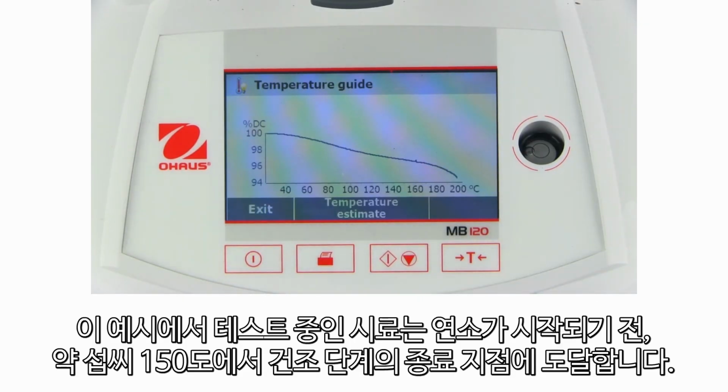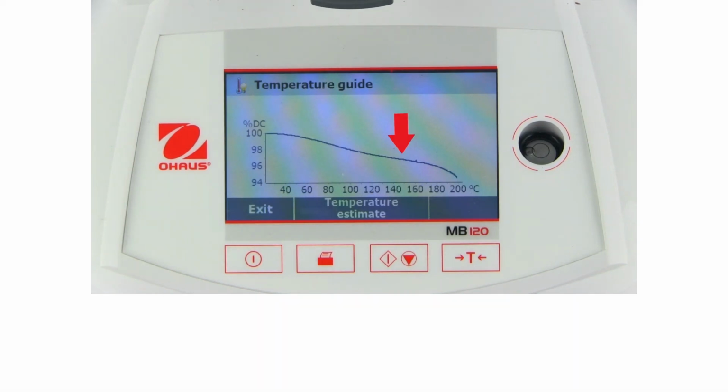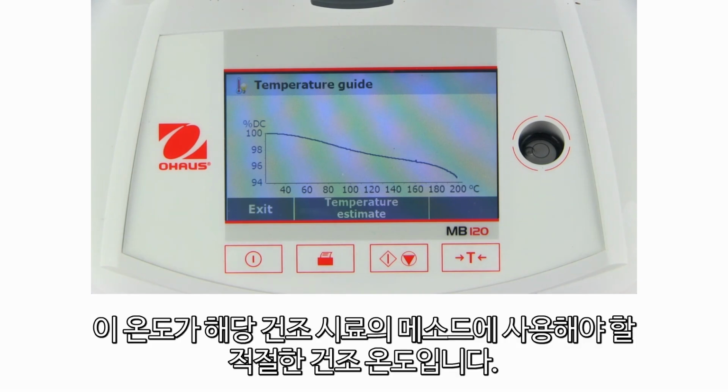In this example, the sample under test reaches the end of the drying phase at around 150 degrees Celsius before it begins to burn. This is the appropriate drying temperature that should be used in a method for this particular sample.